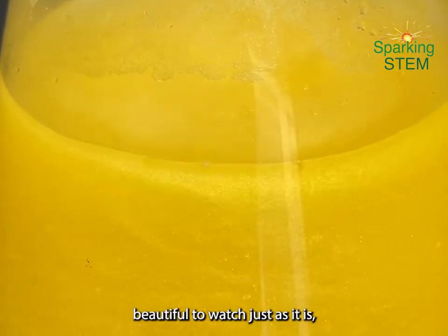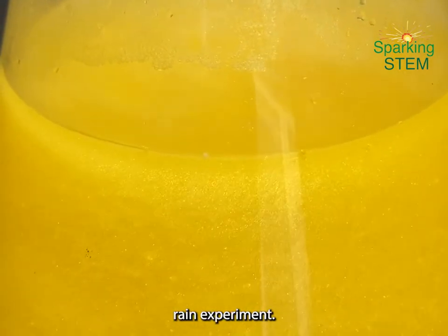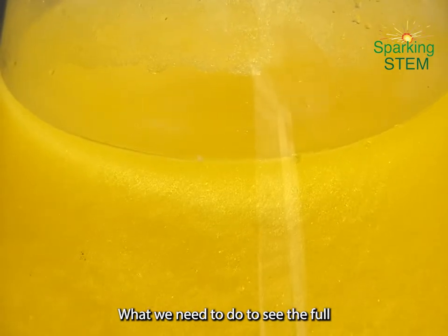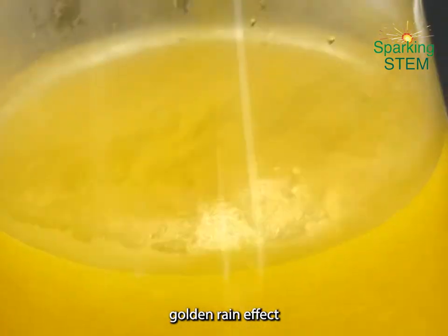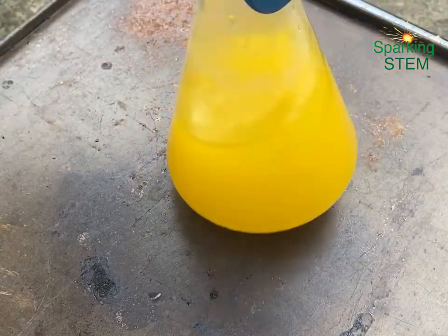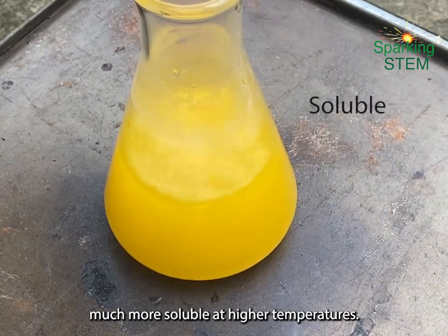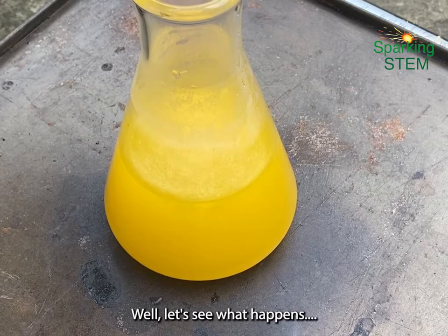Now this is pretty beautiful to watch just as it is, but this isn't the full golden rain experiment. What we need to do to see the full golden rain effect is to heat up this solution so that those crystals of lead iodide dissolve, because they become much more soluble at higher temperatures, and then, well, let's see what happens.